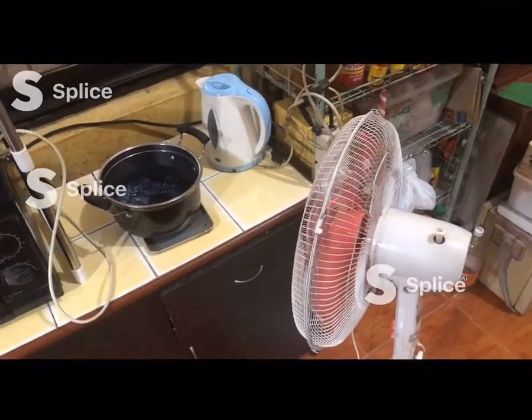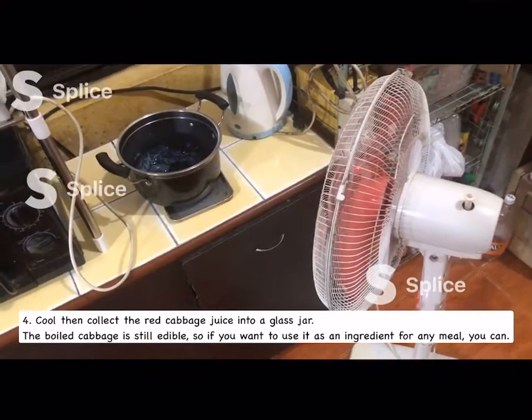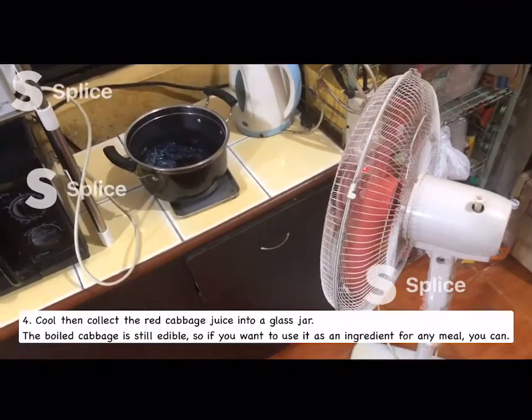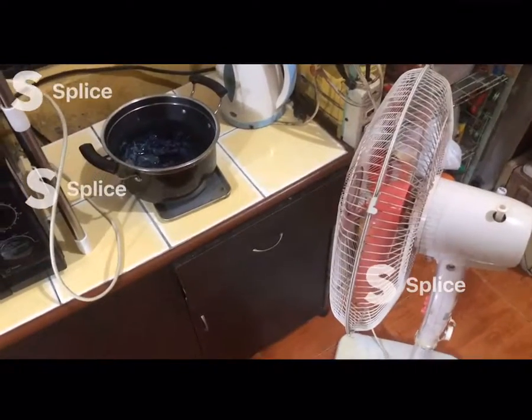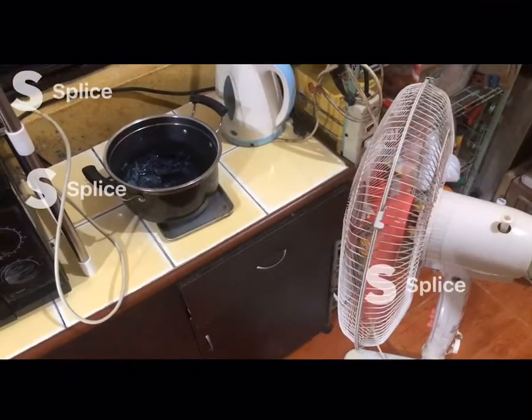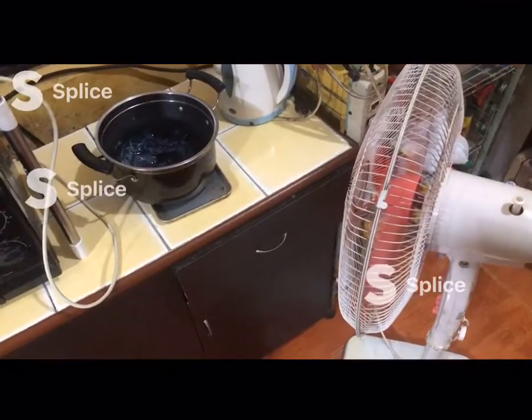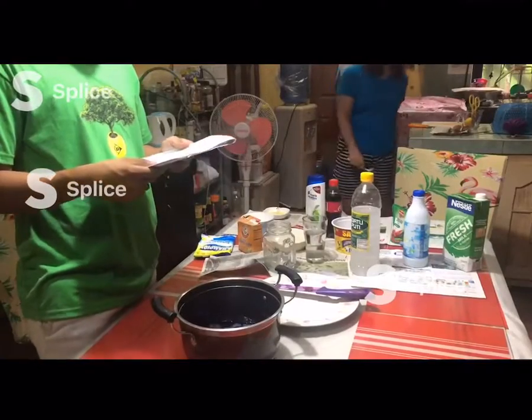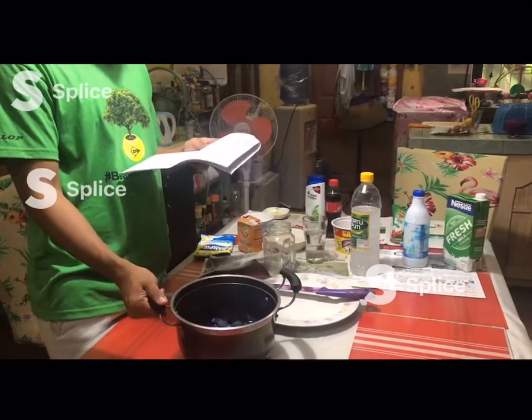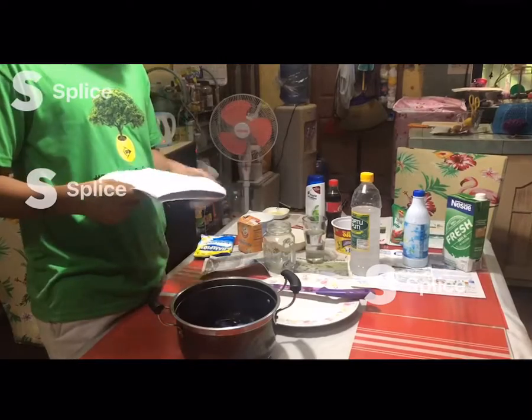So now we are cooling down the red cabbage juice. And later, we will transfer the juice into a glass jar. Now we have finished cooling the red cabbage juice, and we will transfer it into a glass jar.